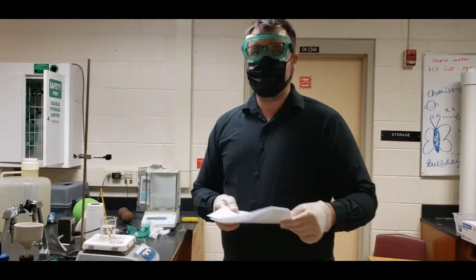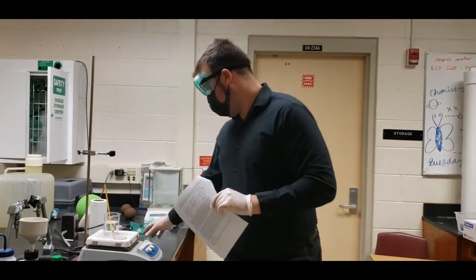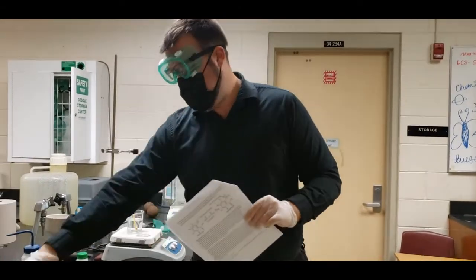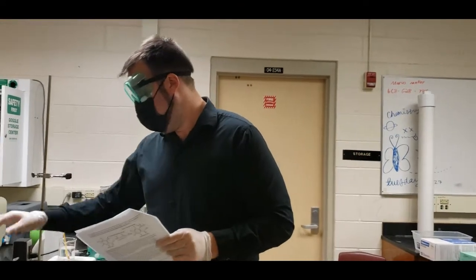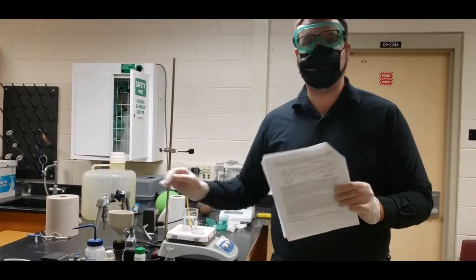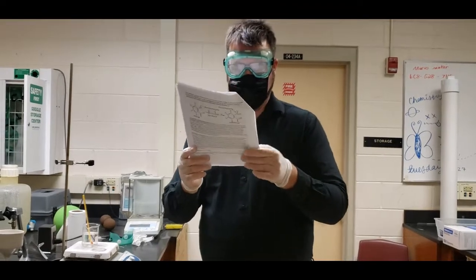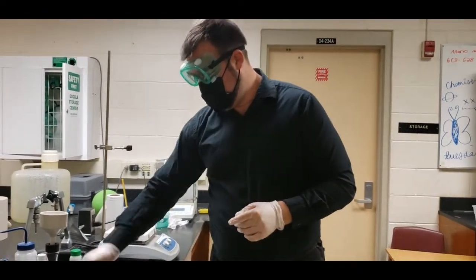We have capillary tubes that we're going to use for testing. And we have 2 Erlenmeyer flasks. One small flask and then one larger flask that we are going to be using. Today we're going to go ahead and use a filter, and we're going to use vacuum filtration instead of funnel filtration today.